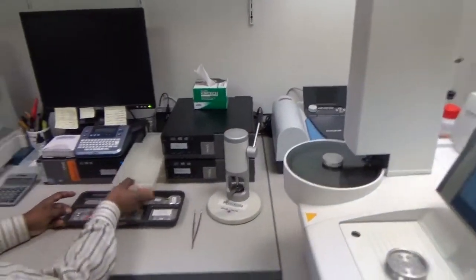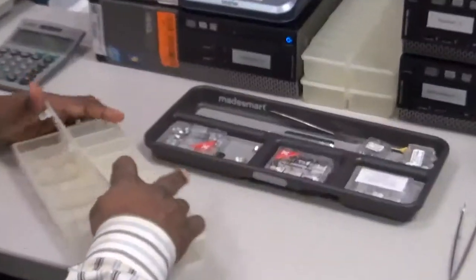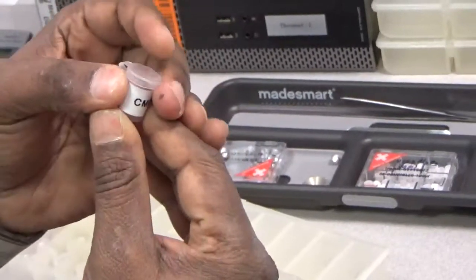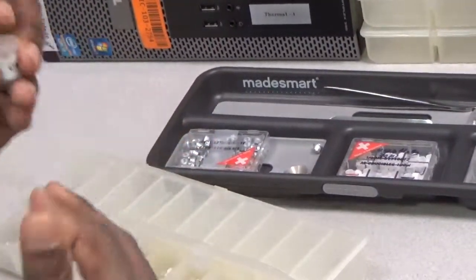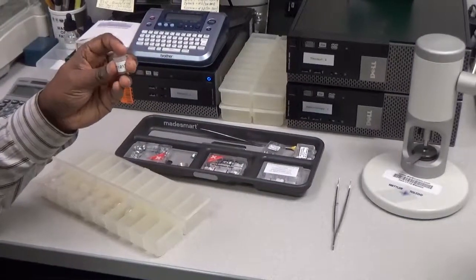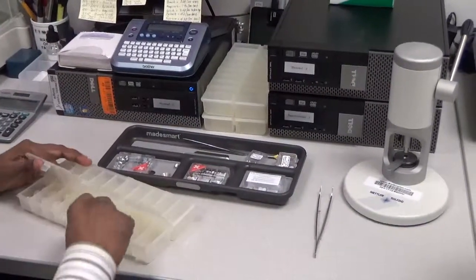To run a sample, we use small containers. Here are the different vials we use to load our samples. We give the CMC project number for each sample that we run and keep the powder sample. Usually we pulverize the sample to pass a number 50 sieve — finer than number 50 sieve — and then we take the powder and load it in the crucible.